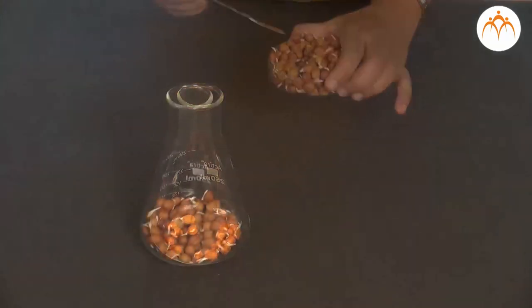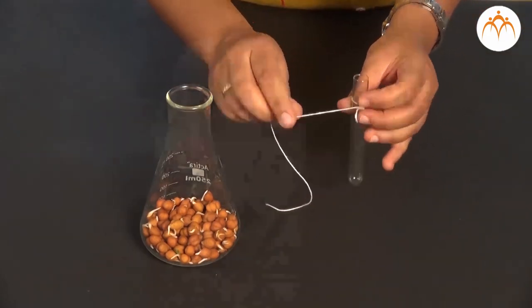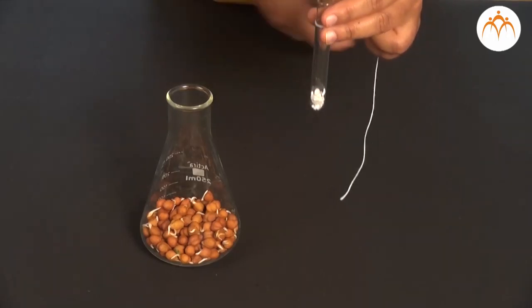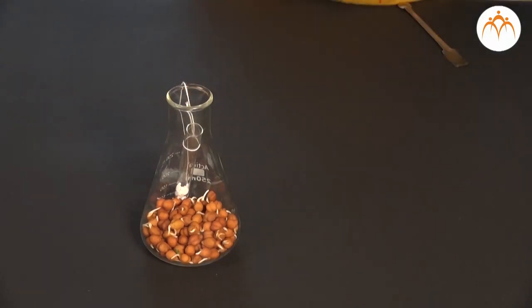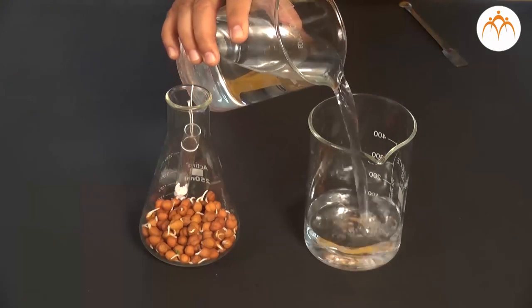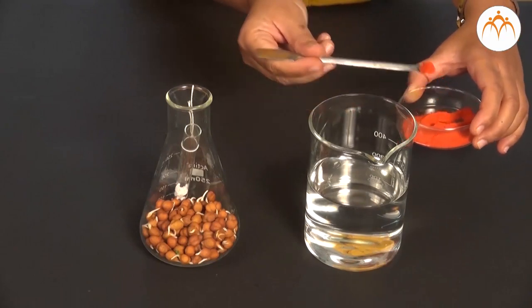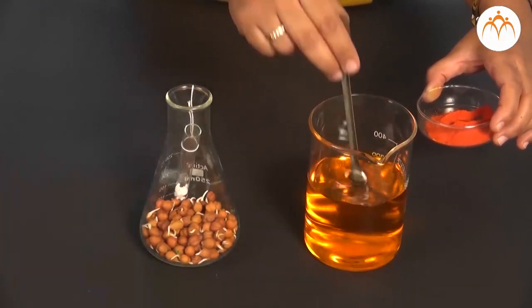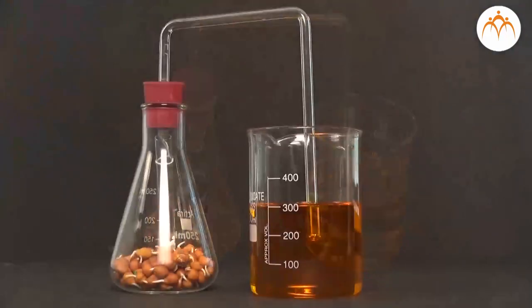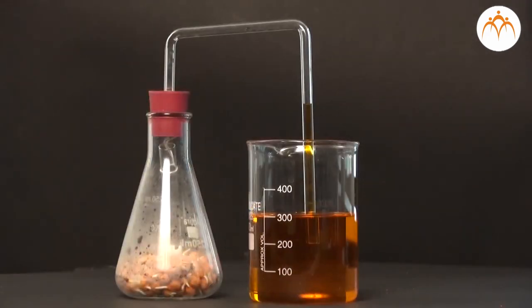Place the sprouts in a conical flask. Insert a small test tube containing pellets of KOH into the conical flask. Close the conical flask tightly with a rubber cork and make the apparatus airtight. Insert a bent tube through a hole in the cork, and place the other end of the bent tube in colored water. Mark the initial level of solution in the tube.